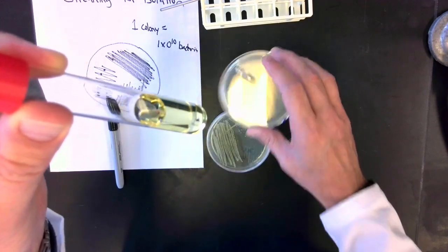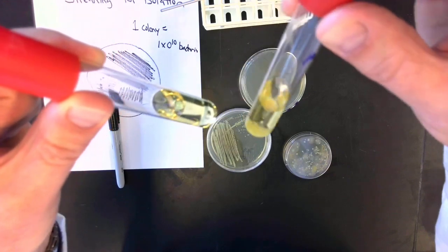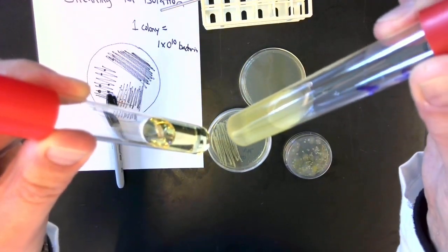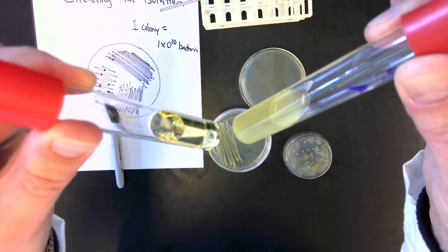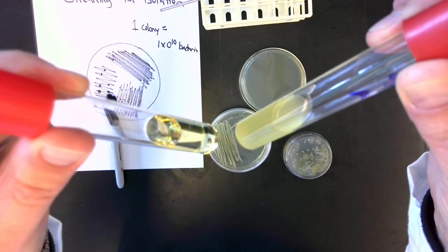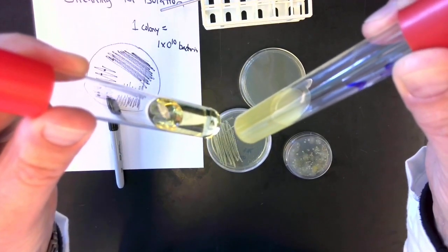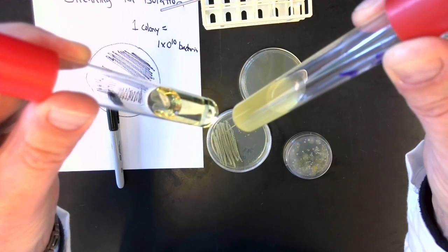This one has no agar, so it stays liquid. If we inoculate that with bacteria, then shake them up because they settled out, you can see they grow and make the medium turbid. In every milliliter of medium here, there are approximately 10 to the 9th bacteria growing.